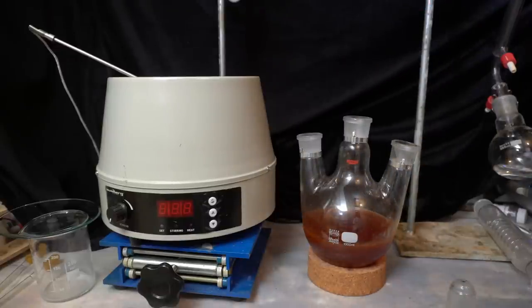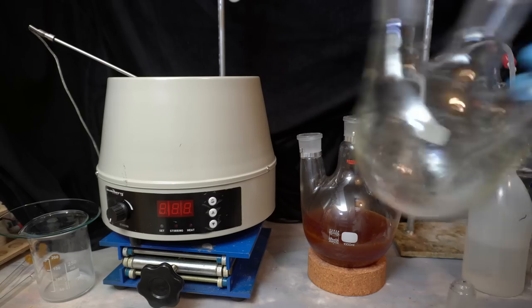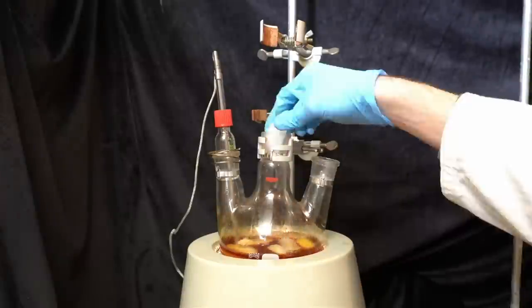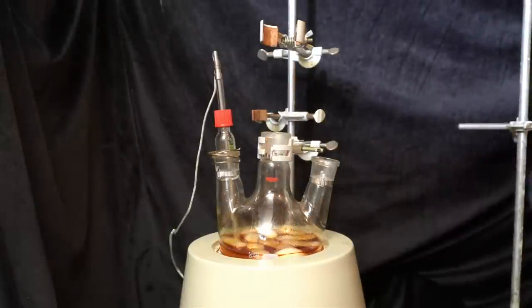Because this will require a large volume of acid I transfer the mix into a 1 liter flask and I also put some ice in the flask to help cool the mixture as this process will be very exothermic.